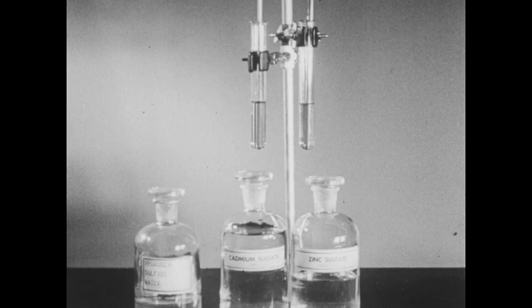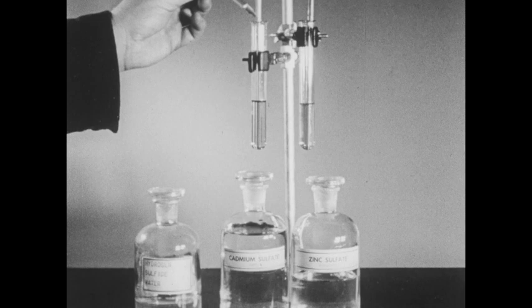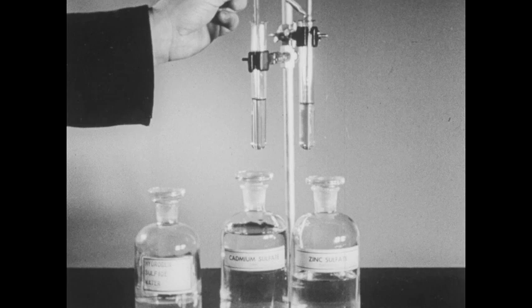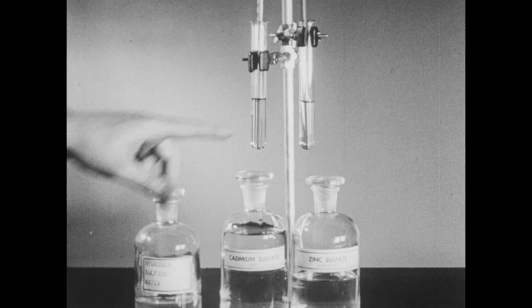It goes through a greenish color at about three-tenths normal acid and becomes yellow in solutions more acid than three-tenths normal. I'll add a few drops of hydrochloric acid to each tube and stir. This produces a blueish-green color, and finally the green color. We can produce the same green color in the zinc sulfate tube as well. The hydrogen ion concentration in these two tubes is now about three-tenths normal.